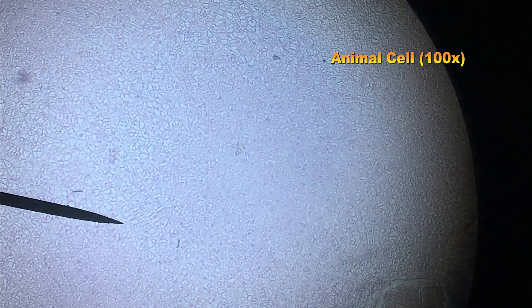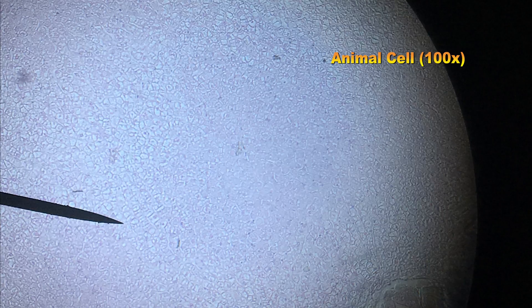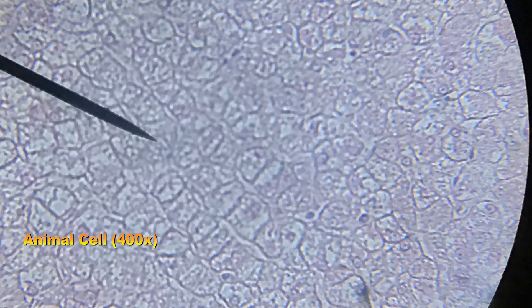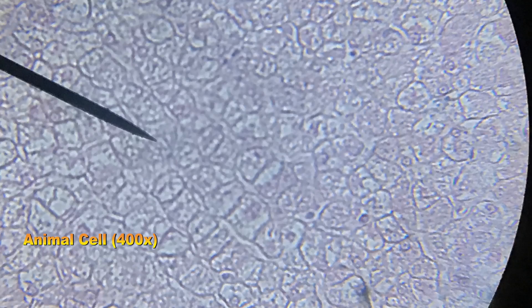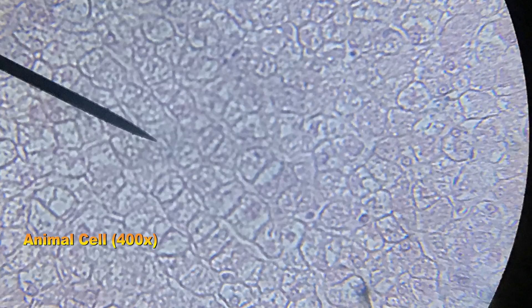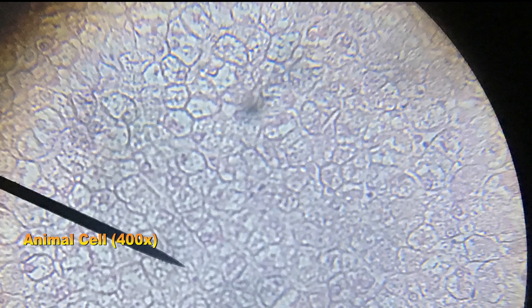This is the still frame of the animal cell on low power. You can see the individual cells here — there are many. This is the animal cell on high power. Zoomed in a great deal, you can actually see individual cells with individual nuclei and structures.